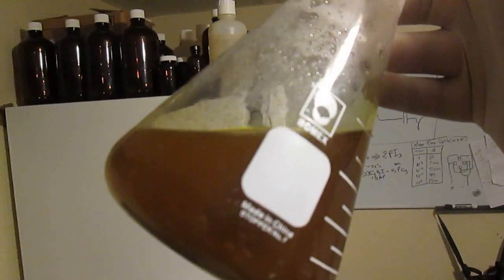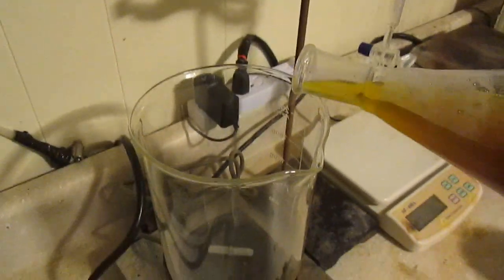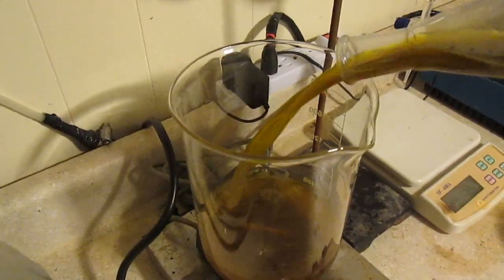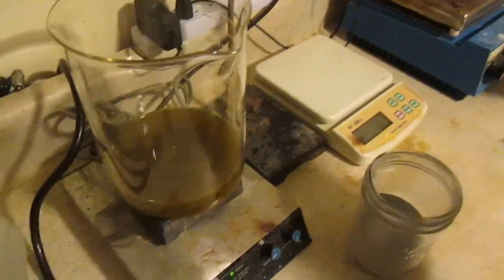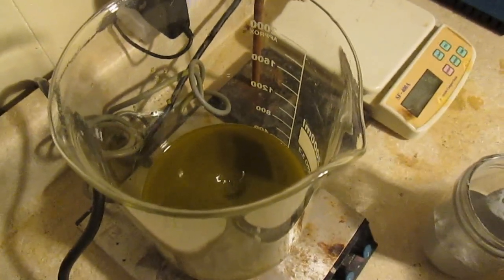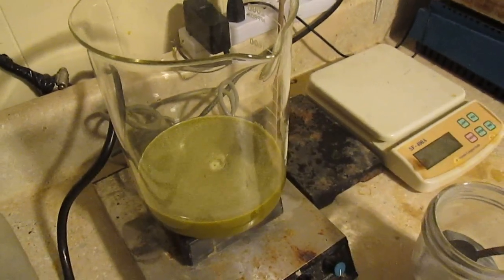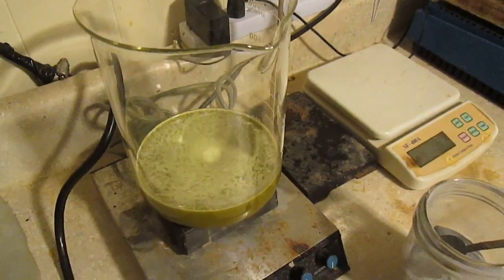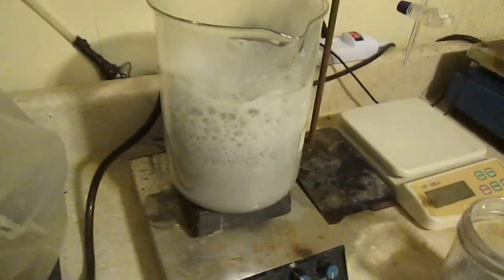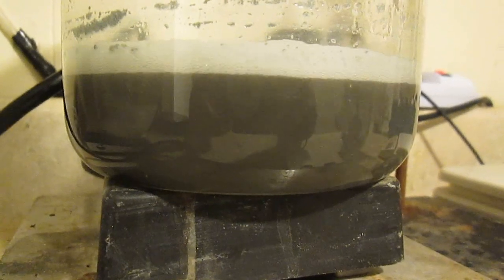Here's the solution — it should have most of the mercury in solution. We're going to reduce it with aluminum powder, but very slowly. I'm putting it in a bigger beaker just in case. Now it's time to add the reducing agent — aluminum powder. I thought it was going to foam up a lot, so let's just be slow about it. This is a kind of delayed reaction, so it may foam up later.